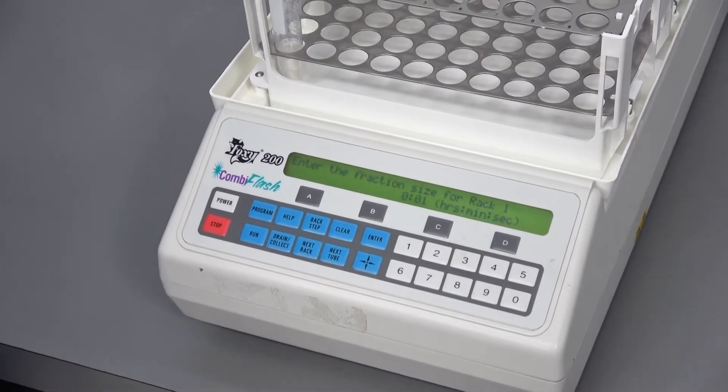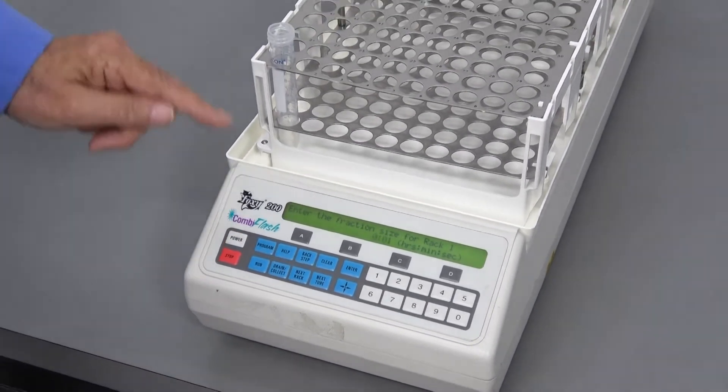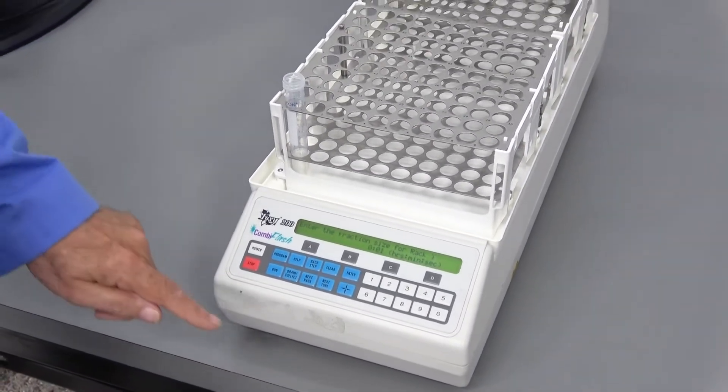Here's where we tell it how long we want the unit, the HPLC system to dump into each vial. Here we're going to, for speed, we're going to have it do one second.